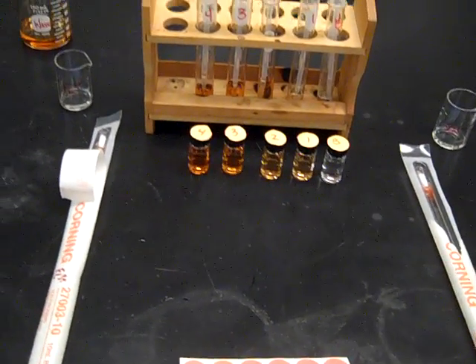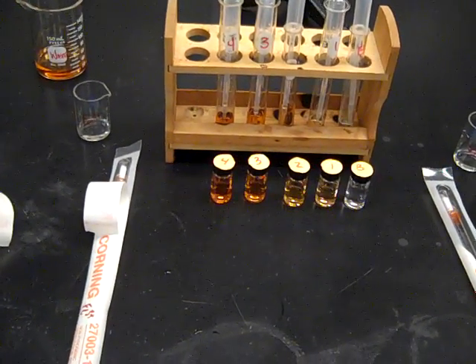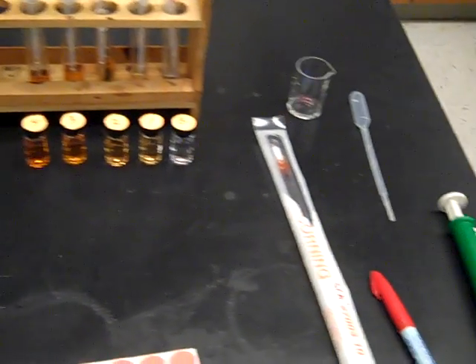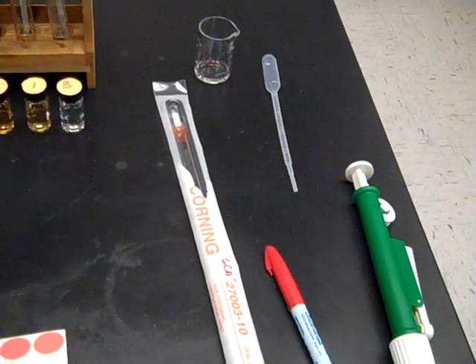This is the lab setup for determining the equilibrium constant for a reaction. A quick cursory look at our setup.